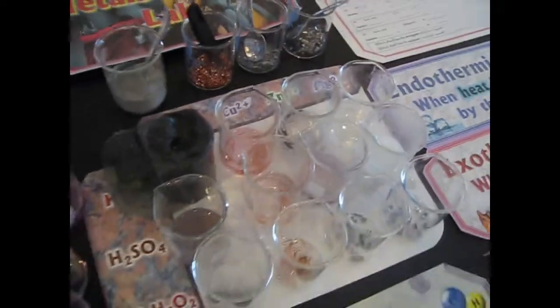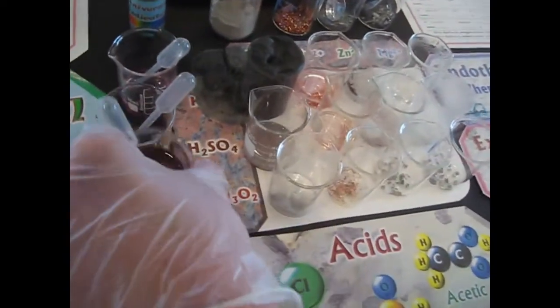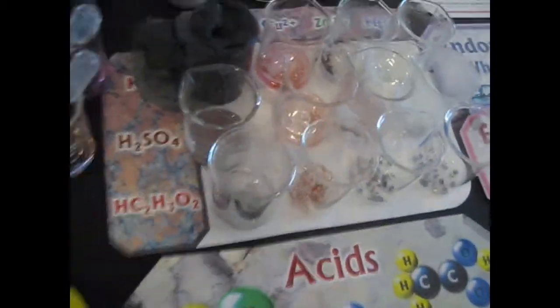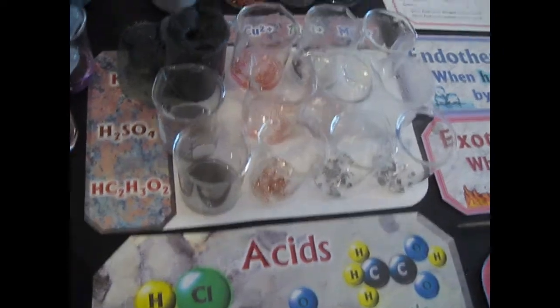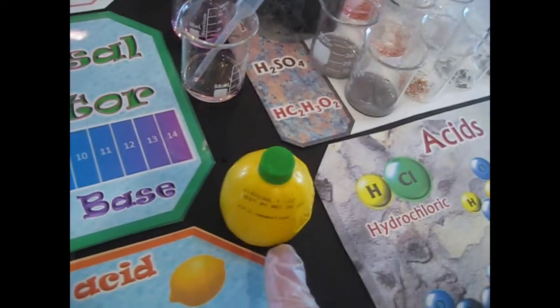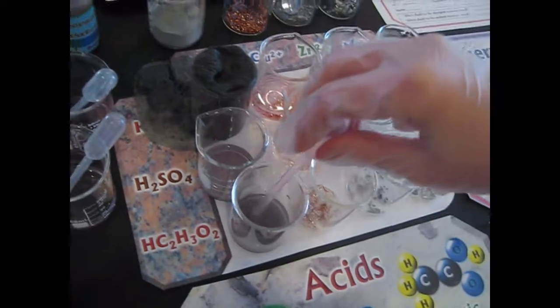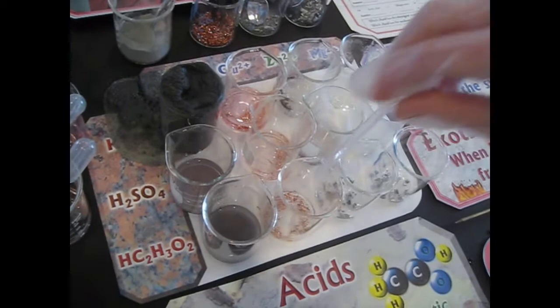Okay, so what's the next one, Giovanna? What's this one? That is acetic acid. So now she's putting in the acetic acid. Acetic sounds like the word acid, right? And that's not a coincidence because the word acid and the word acetic came from the same root, which means sour. Think of a lemon, right? Sour like a lemon. So we're not going to taste these because imagine what these would do to our tongues. We don't ever taste lab materials, but if you did, they would be sour.